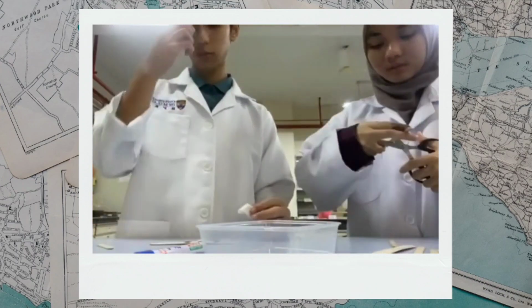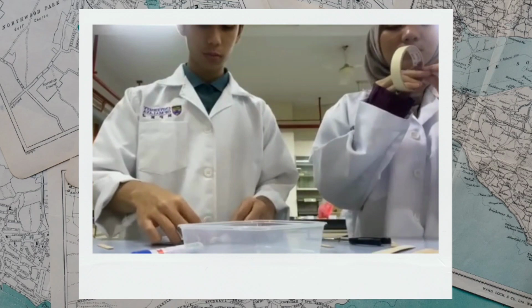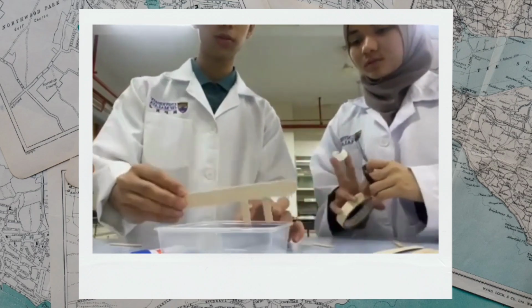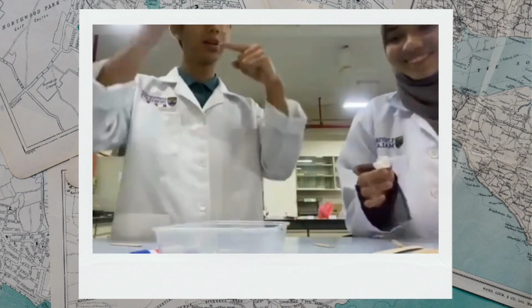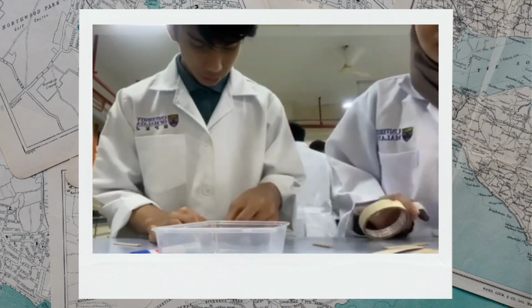First, you will need to make a comb to create wells in the gel that will eventually hold your samples, which is the food coloring particles. Rest a regular sized craft stick on top of the small plastic box. Cut the narrow craft sticks into several shorter lengths as follows.